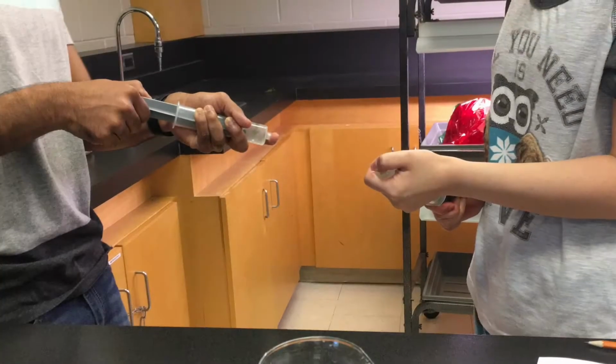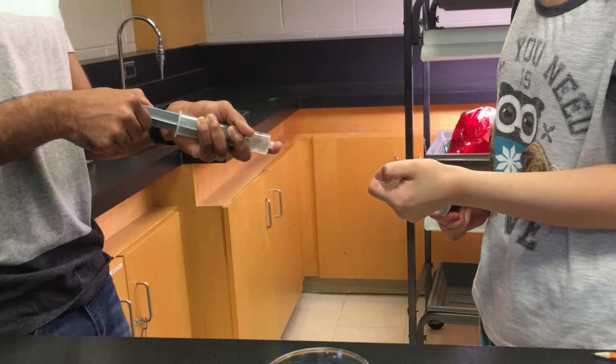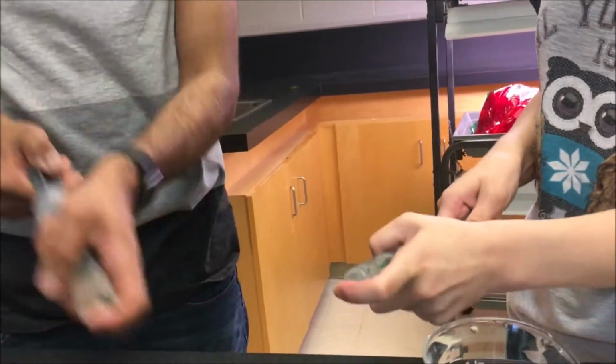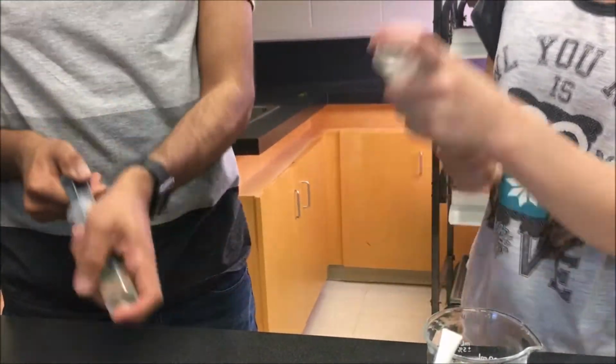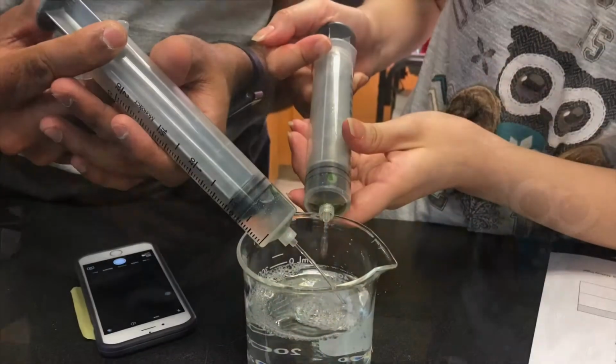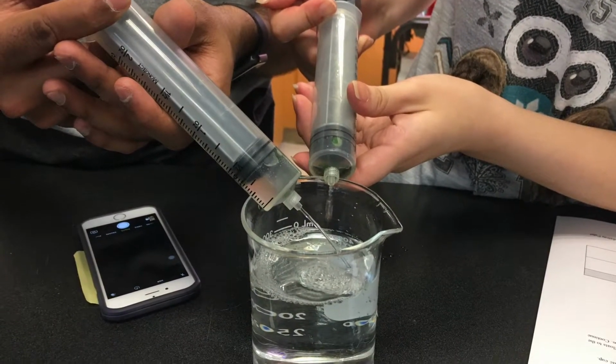Create a vacuum in the syringe by placing a finger over the opening and pulling back on the plunger. Hold this position for about 10 seconds. While maintaining the vacuum, move your hand in a circular motion to swirl the leaf discs and suspend them in the solution. Let go of the syringe to release the vacuum. Repeat this step 2 to 3 times until all the discs sink properly.